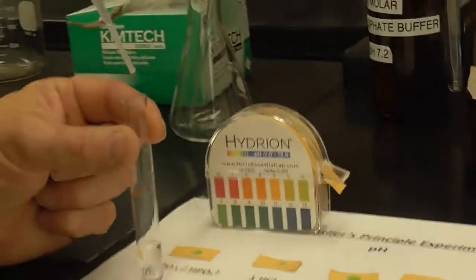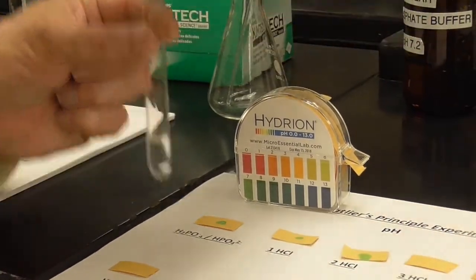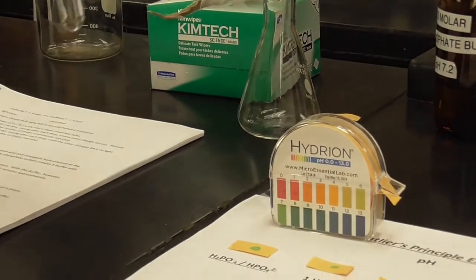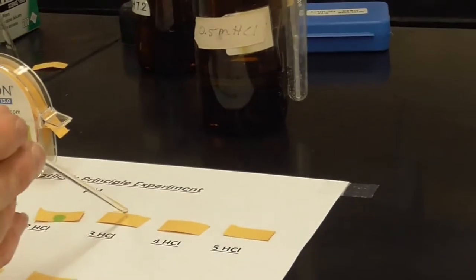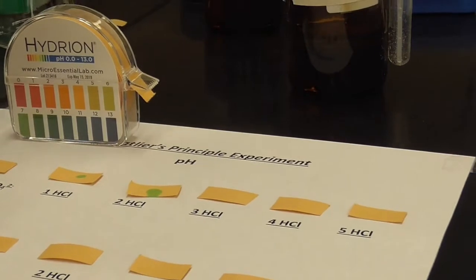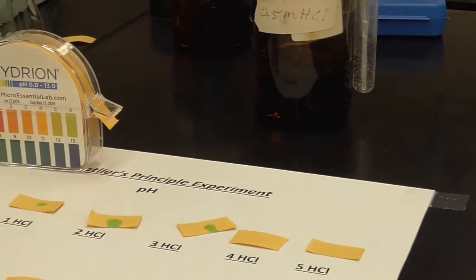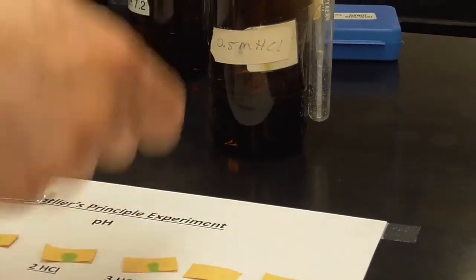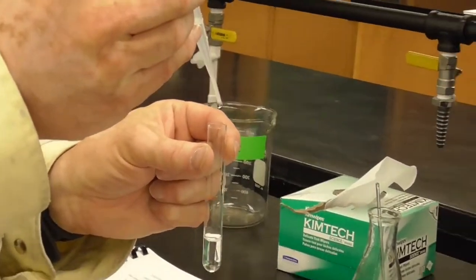Here's the 3rd drop going in. Okay. You can just stir it with that. That works just as well, right? Didn't get enough on there. Try again. There we go. Okay, here we go with the 4th drop. No, that was an air bubble. That was not a drop. There's the drop.